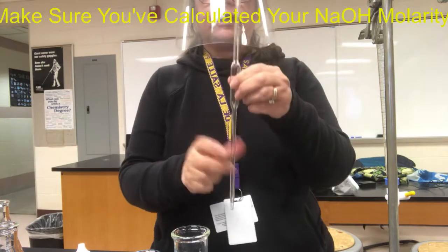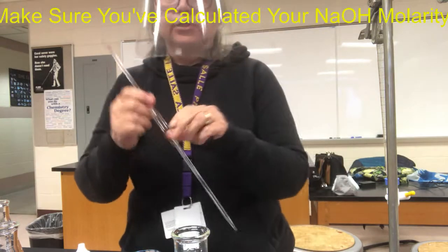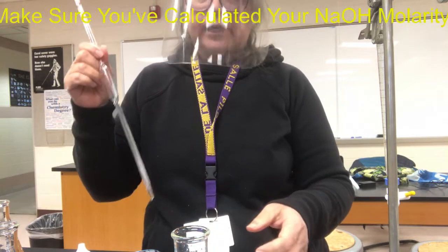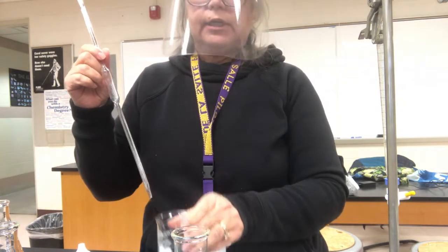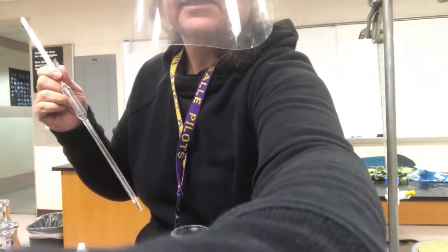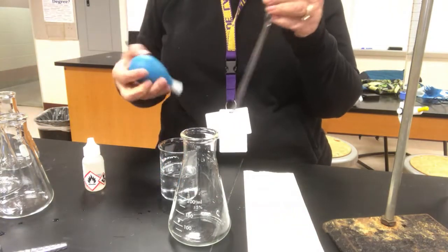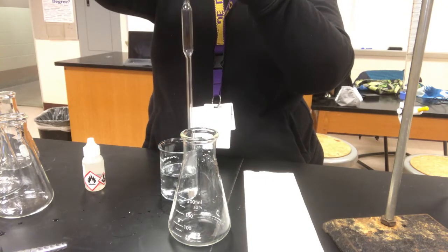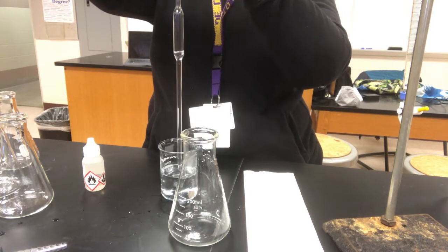And I've already rinsed out the pipette with the hydrochloric acid, so I'm not going to do that for you again. I'm just going to go ahead and directly pipette the hydrochloric acid from the beaker into this Erlenmeyer flask. So let's take a look at that. Remember with pipetting, we're going to squeeze the bulb. We're going to use the bulb to draw the liquid up into the pipette.